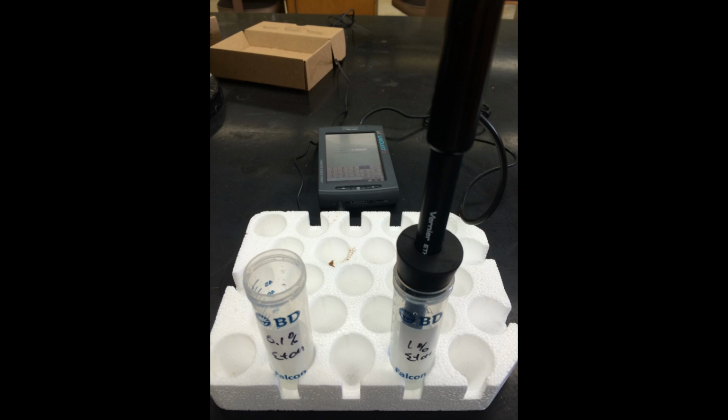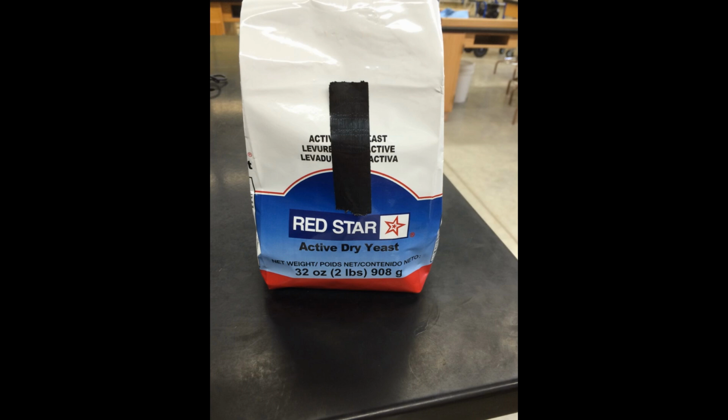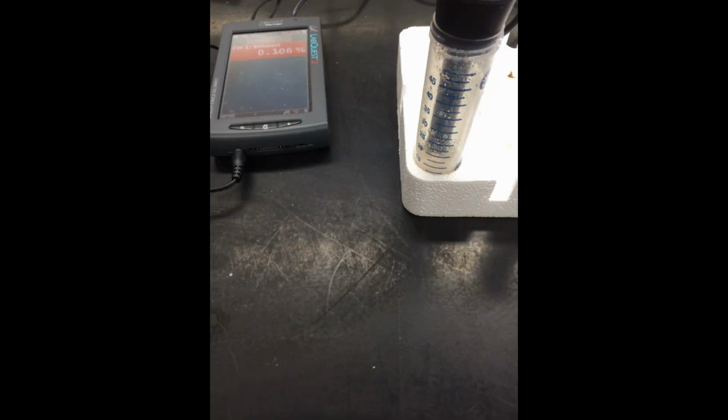Repeat these steps for the 0.1% solution. When both solutions have been measured, hit Storage tab, then save calibration to sensor. The probe should now be correctly calibrated. Place approximately 10 milliliters of yeast suspension into each Falcon tube for the standard amount. Record the time you started. Test the initial ethanol concentration using the ethanol probe. Record this data and time.